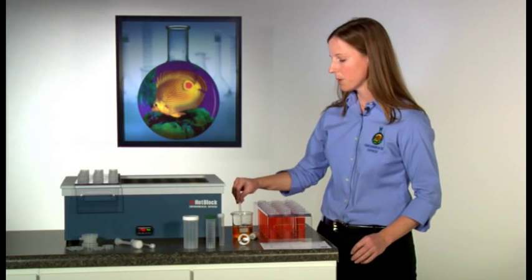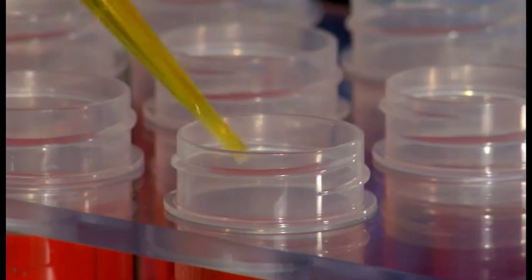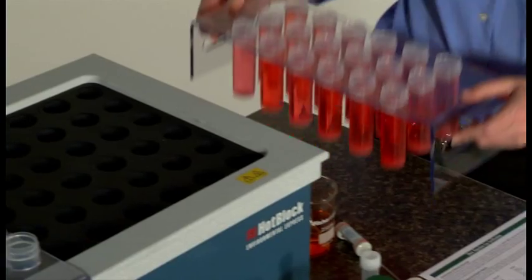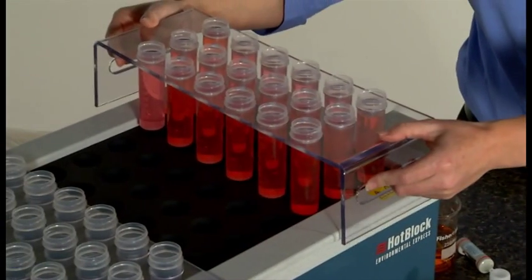Next, add the appropriate reagents and load your samples into the block.